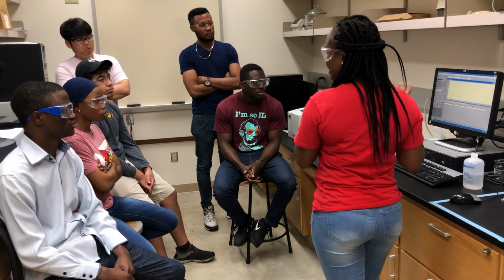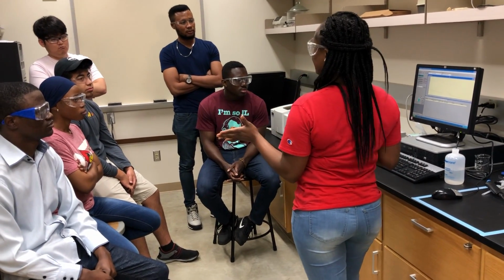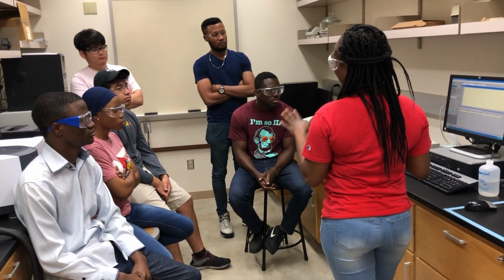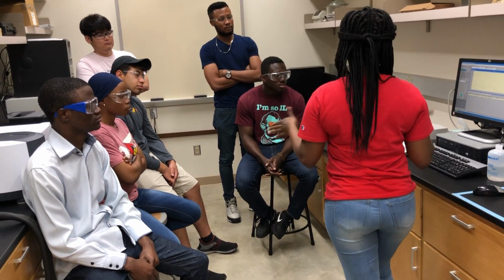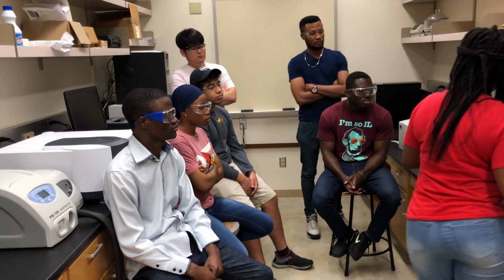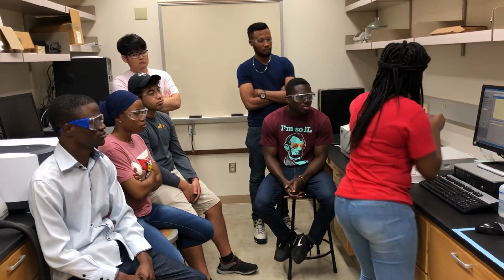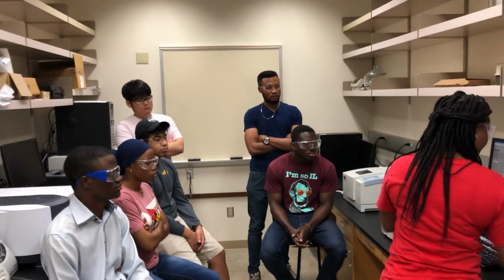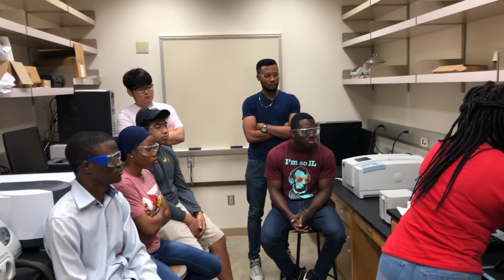So as we move on to the other concentrations, you will see the difference. Looking at the SPR, you are going to know whether the particle is bigger, smaller, or medium size. So let's try the next one. After the first run, you just wash this off with water. So this is what I do.